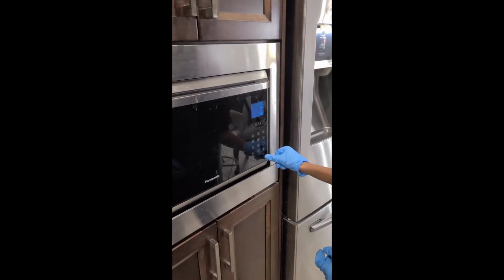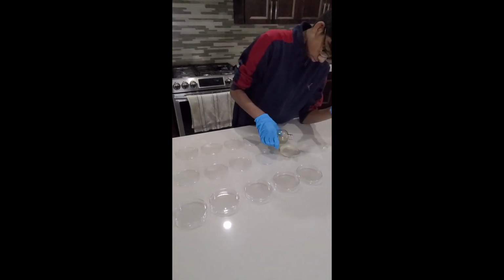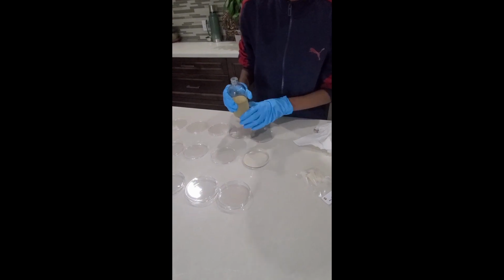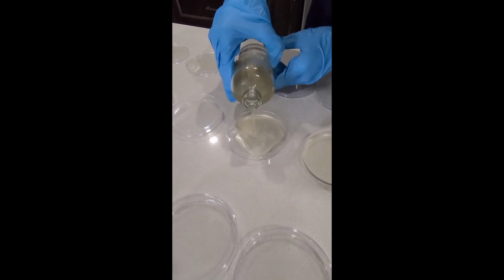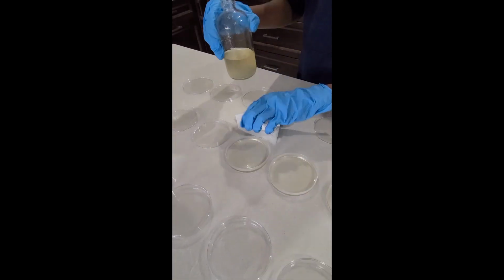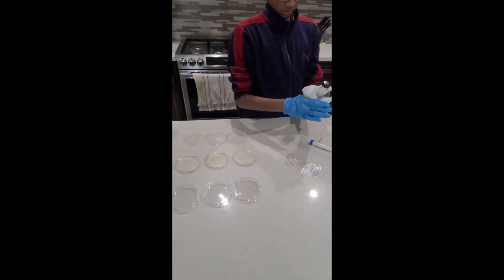Do the same for the LB strep agar powder and then pour each of these solutions into 7 petri dishes, with a total of 14 petri dishes. Let the plates cool for about 30 minutes before putting the lid back on, then leave them to dry overnight or a couple hours works just fine. After that, flip the petri dishes upside down and then store them in the refrigerator.